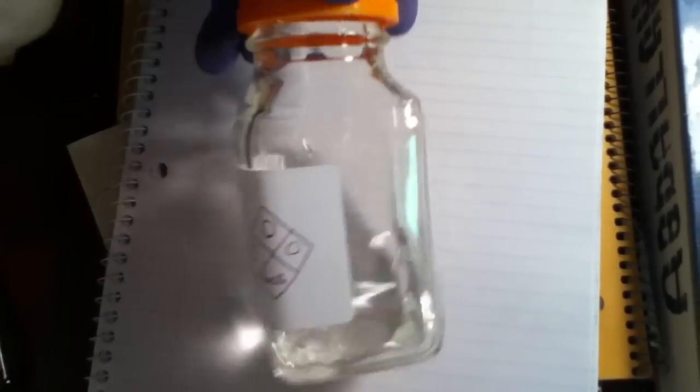Here is the final product of two batches. This arises from eight total gallons of bleach.